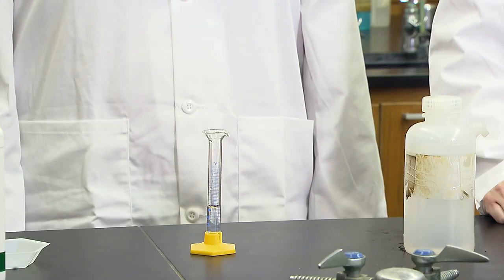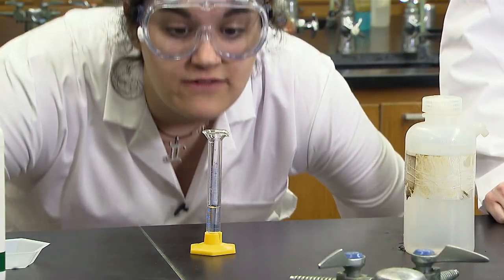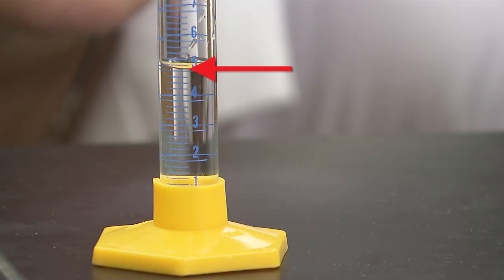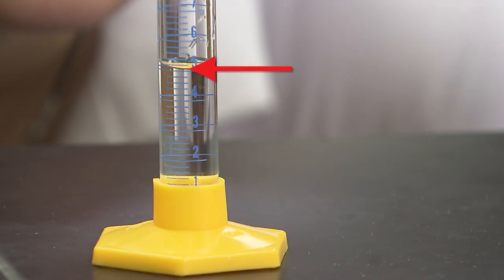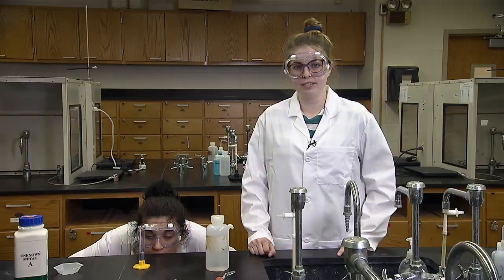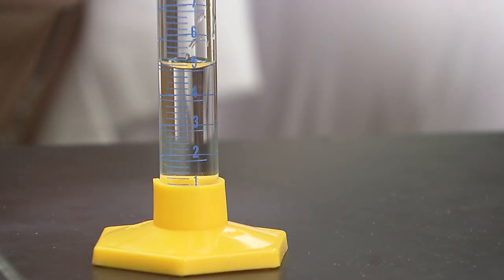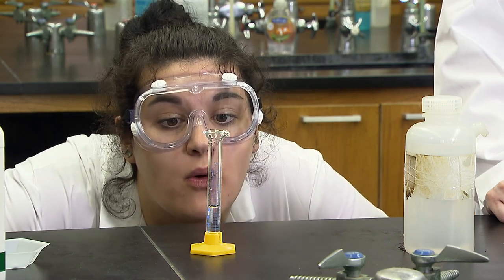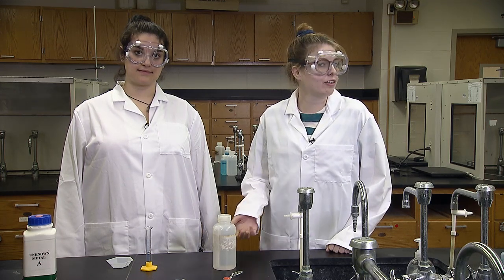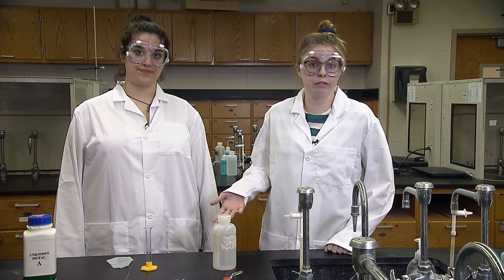Now, you determine the initial volume by looking eye level at the bottom of the meniscus and not the sides. When you record it on your data sheet, you will need to estimate the volume to the 10th place. Watch How to Read Graduated Glassware video for more detailed instructions. It has 5 milliliters, so I will record 5.0 milliliters. Any time in lab that your measurement is an integer, you will record the decimals as zeros. For example, 10 grams would be 10.000 grams.